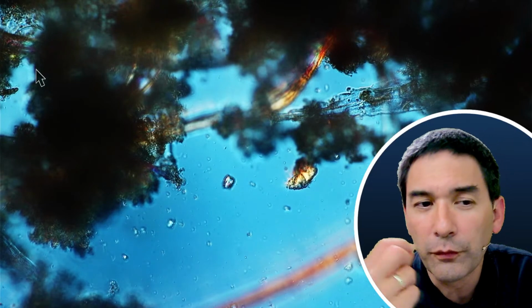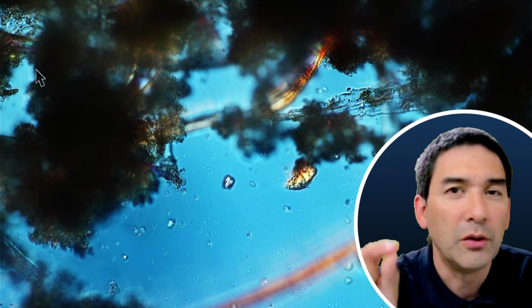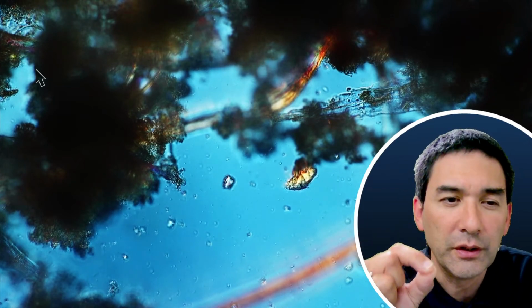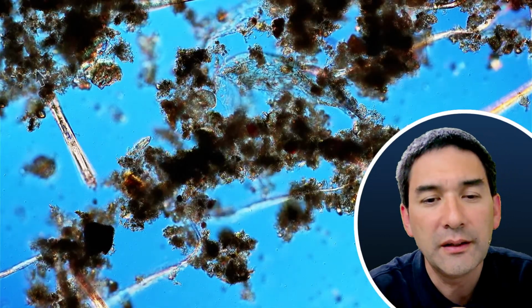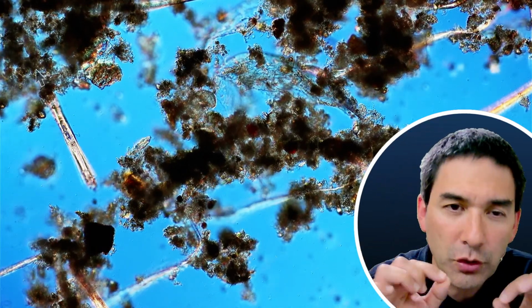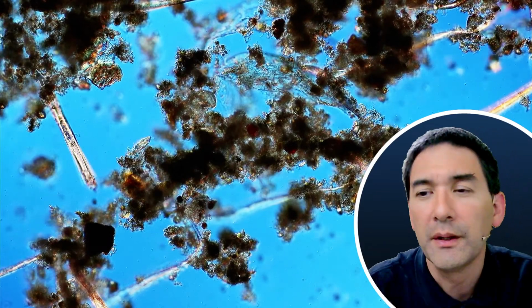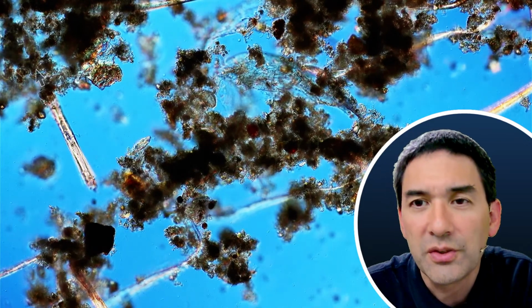There are of course certain bacteria that move a little bit uncoordinated, but even then the movement is stronger. And those particles are so small that even if they were bacteria, they could be moving by Brownian motion. But actual real movement is in many cases way more directed. So it's almost like you know it when you see it.